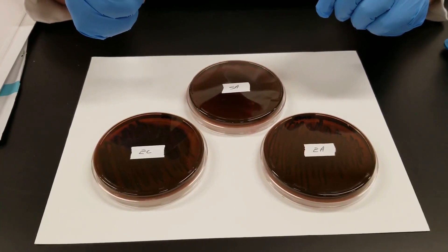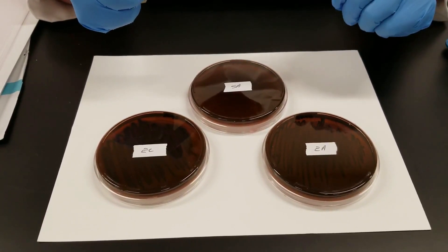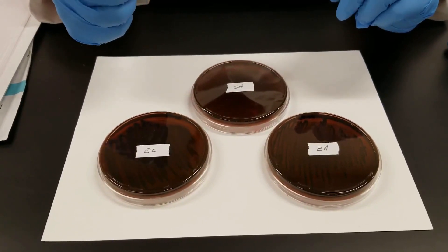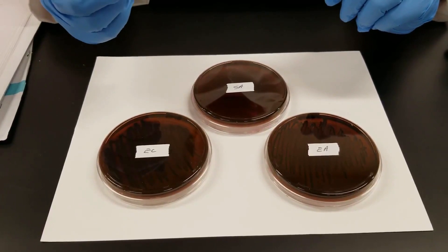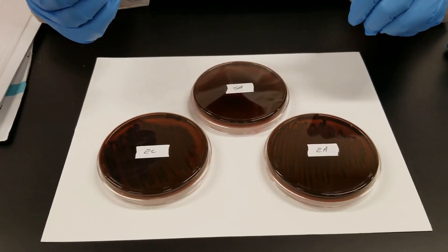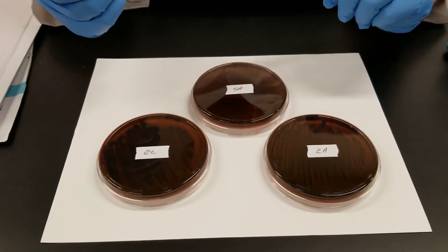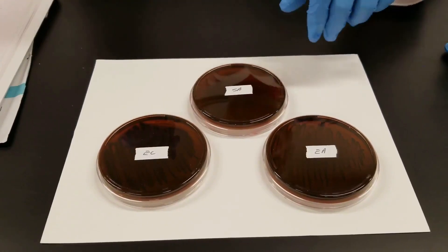It is differential in that you'll be able to distinguish E. coli, which is commonly found in most animals in the fecal material, exists naturally in our intestines, and is used as an indicator organism for water quality. You can distinguish between E. coli and other enterics — other bacteria found in the intestinal system.